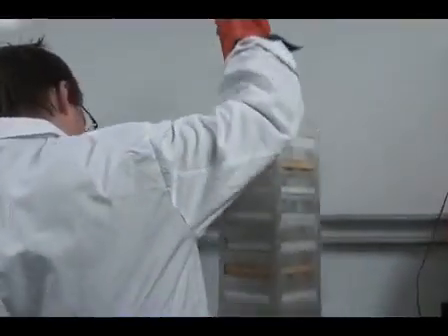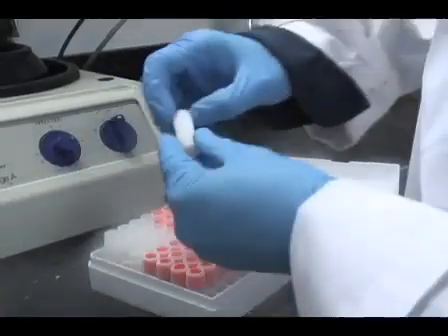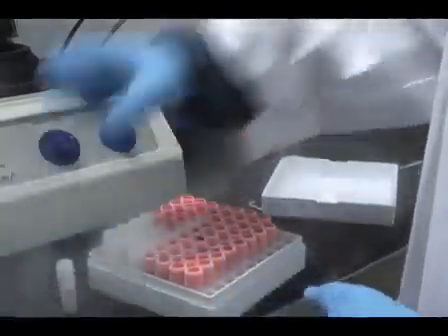Previously, fibroblast cells from embryonic mice with a floxed RAC1 allele were isolated 12 days post-fertilization. These cells were then placed in liquid nitrogen for long-term storage, and we will begin by thawing a single vial of these cells, representing one embryo.